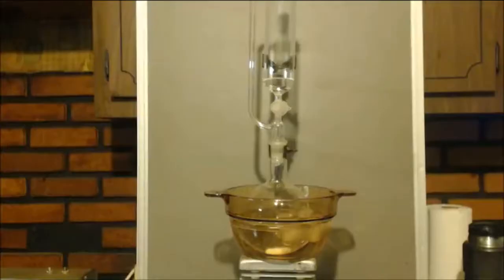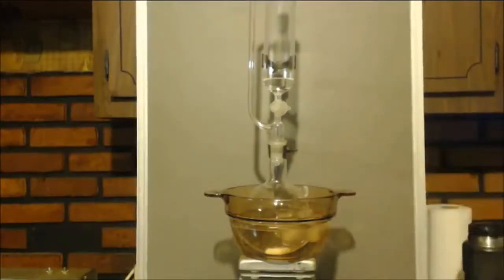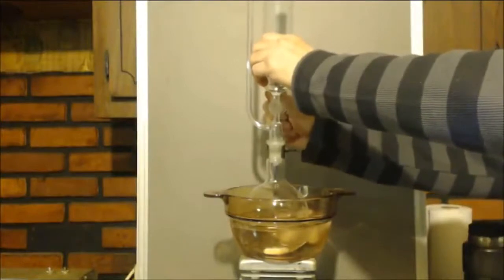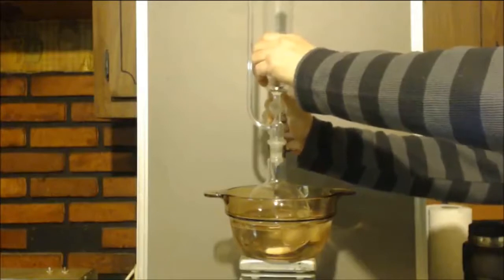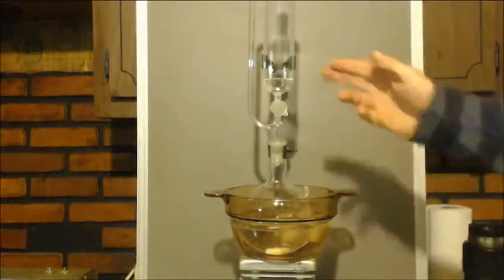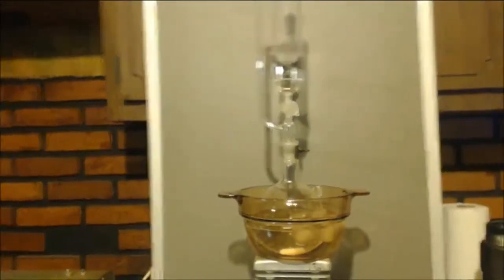Alright, in this bottom flask I have it in an ice bath, and I have some antifreeze in there, some ethylene glycol. Up here, I have about 20 milliliters of concentrated sulfuric acid, and I'm going to drip it in at a very slow rate. Everything was chilled down, actually just the chemicals were chilled down in the freezer. Let me tell you, that ethylene glycol is like syrup when it gets that cold.